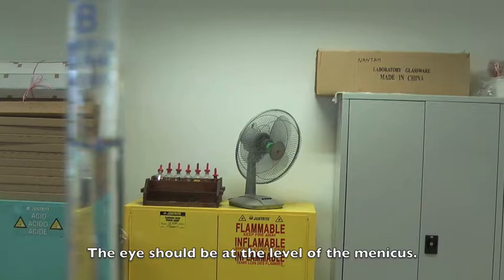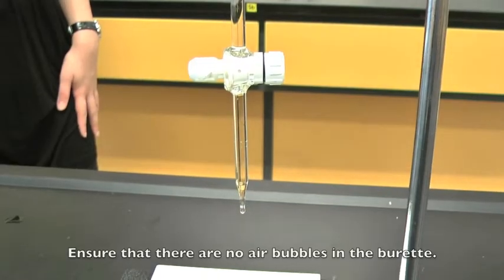Read the scale from the bottom of the meniscus. Make sure that there is no air bubble.